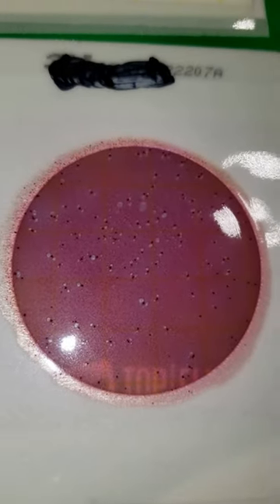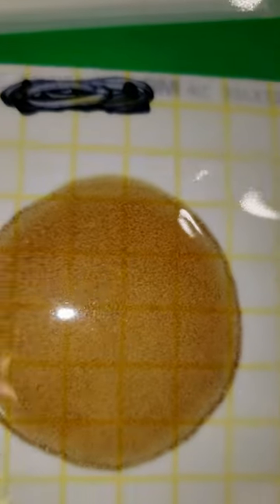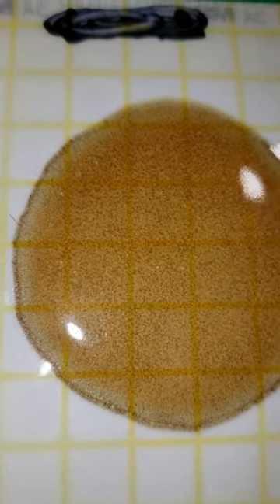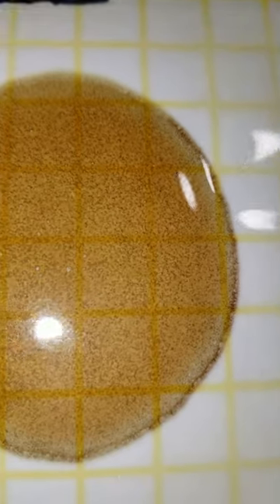Here's our final culture plate. This is a paint horse with metabolic problems. You can see that 70% of this plate is transformed to a yellow color. You can see all the multitude of lactic acid bacterial colonies, some very large, all over. Looking at coliforms, probably somewhere between 100 and 125 colonies — abnormal, high. And on the petri film plate, we've got a pretty high lactic acid bacterial count on this horse as well.